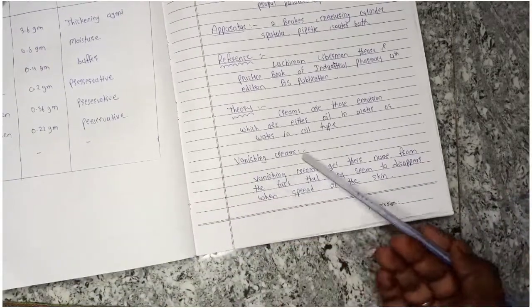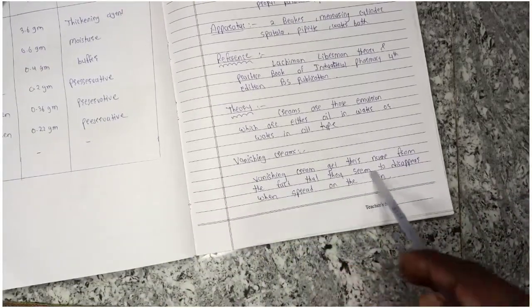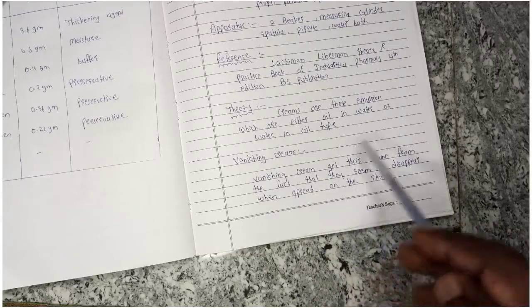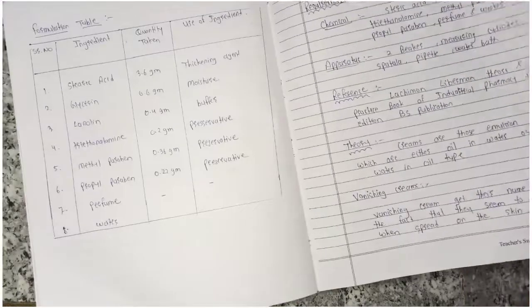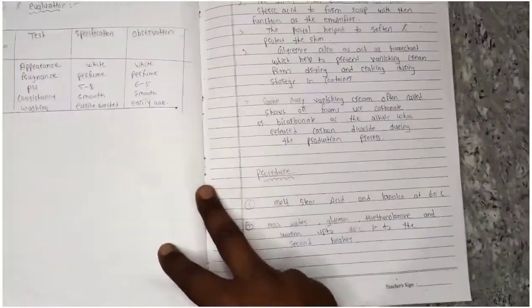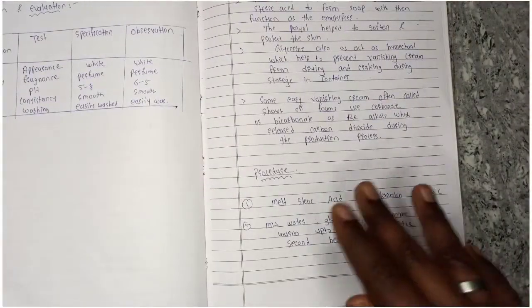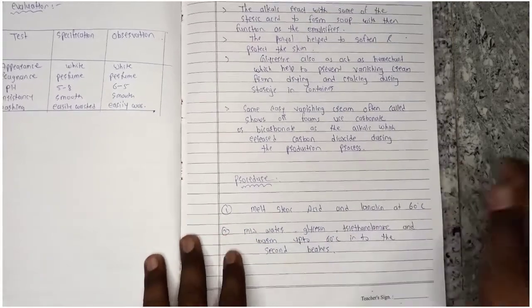First, we will see vanishing cream. Vanishing creams get their name from the fact that they disappear when spread on skin. This cream spreads easily. After that, we will see the procedure.